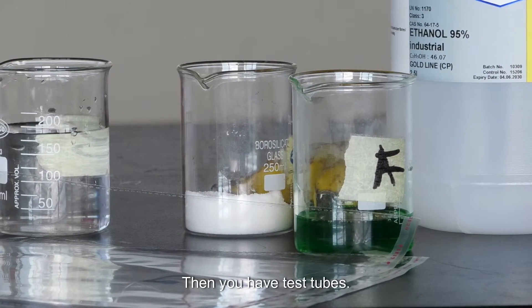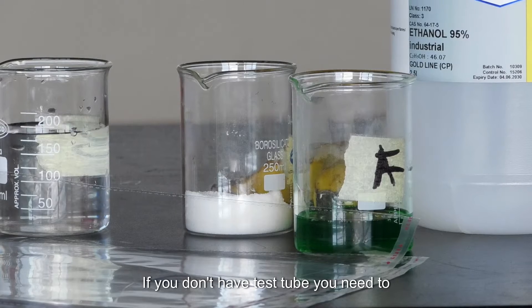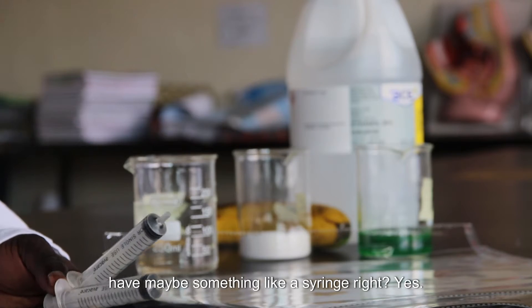Then you need to have test tubes. If you don't have test tubes, you need to have maybe something like a syringe.